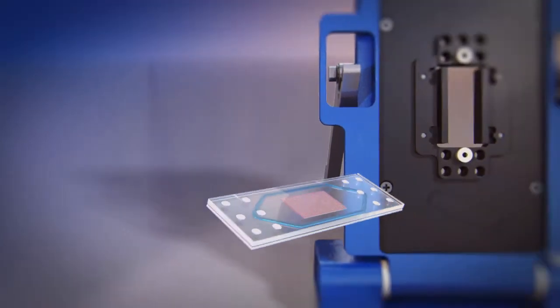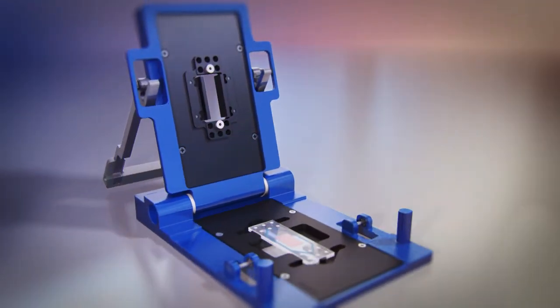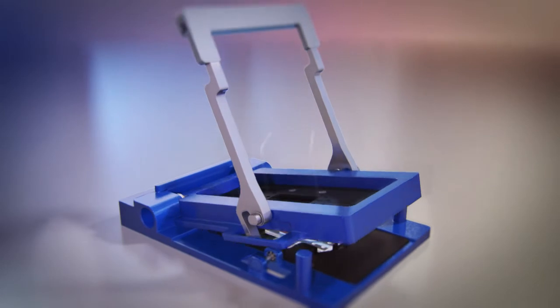After closing the holder, a microfluidic connection is made, creating a continuous flow across the receptor cell array.